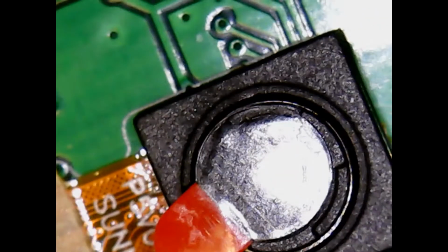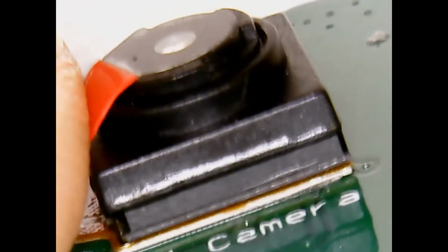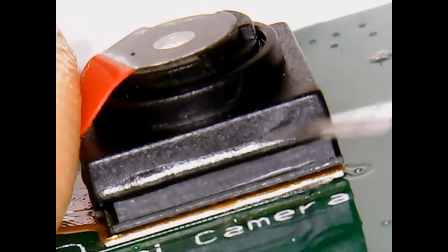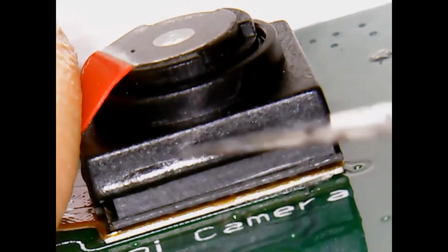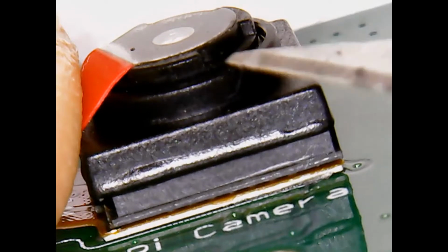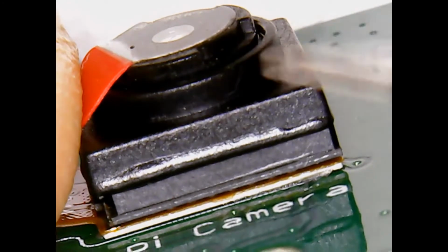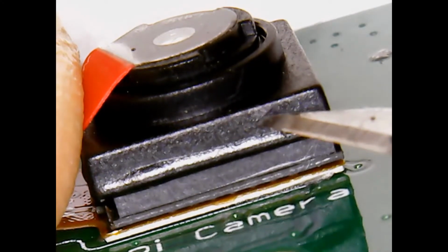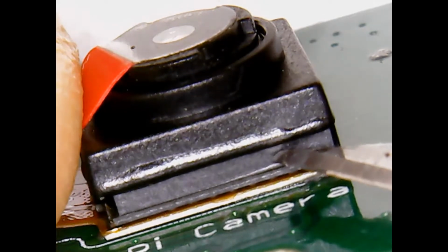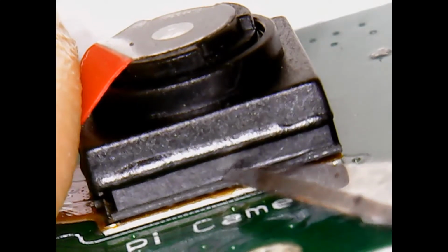I'm using diagonal cutters, very sharp, small ones. Now the key is there's two parts to this plastic casing. Notice there's a seam here, and it's kind of hot fused plastic to seal this. We want to remove the top part, that's this part, which has the lens hold. Here's the lens, it screws in, but they put some glue so you can't rotate it, because they fixed it to the focus they want. This is the upper part of the case. We want to remove this, but we want to leave the bottom part of the case intact because, as you'll see, this houses the image chip with all the glass on top and inside all the delicate gold bonding wires. We don't want to mess that up.